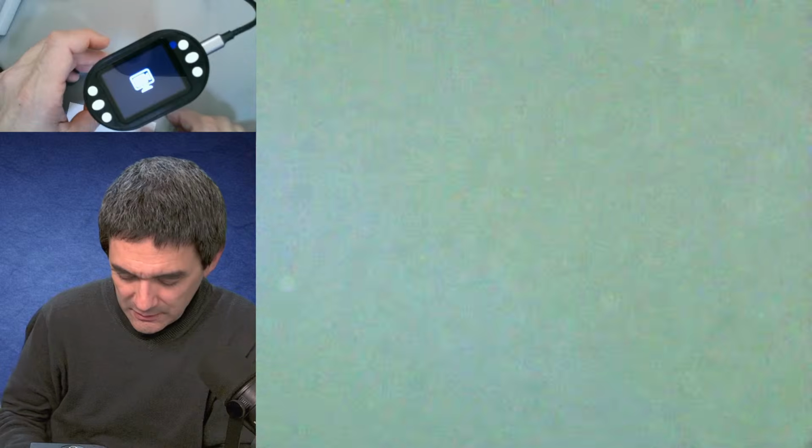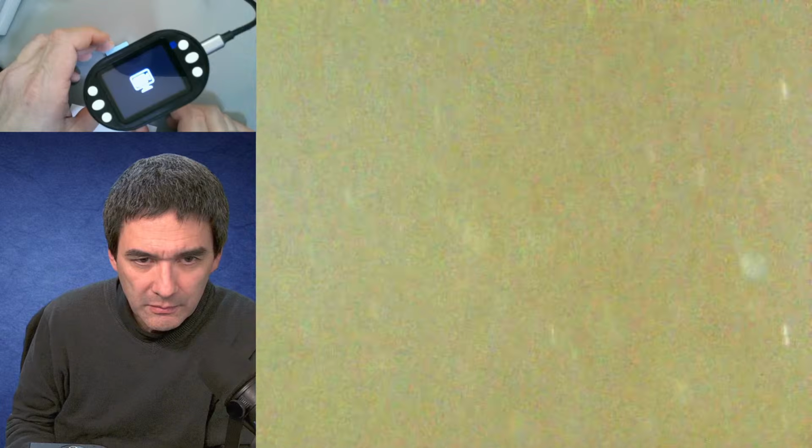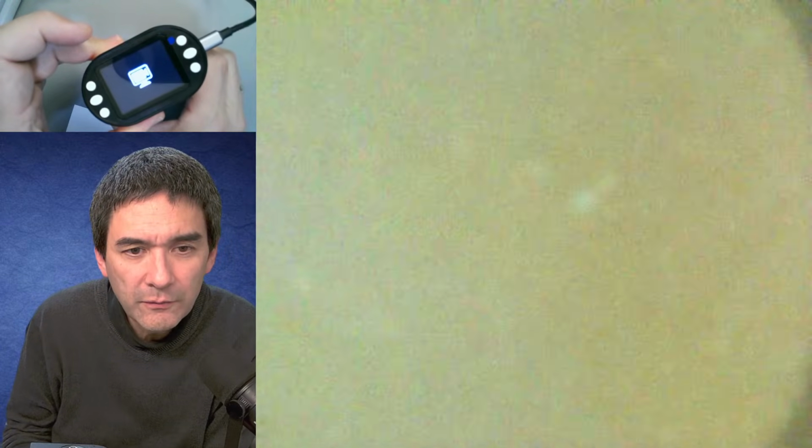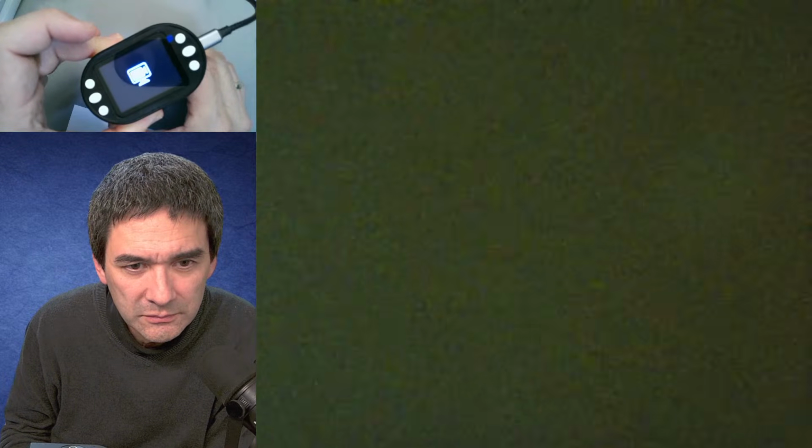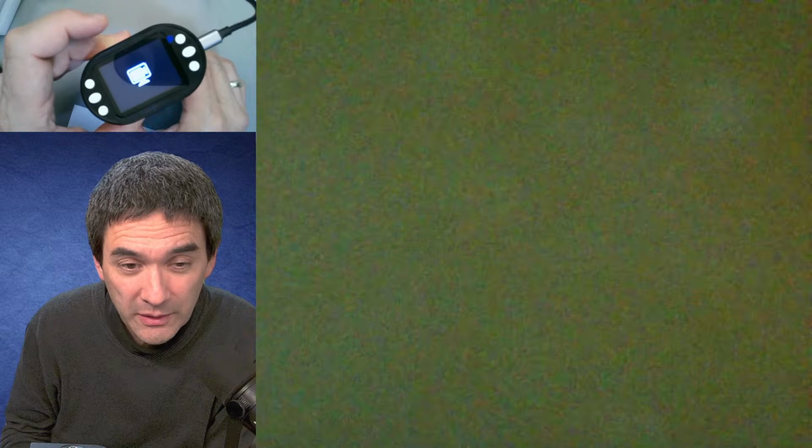I really don't know. Yeah. So. And here we are. I think, yeah, I'm right in the middle here, and let's see if we're able to see something. I'm not able to see something. So let's zoom in more. Let's zoom in more. I don't know if you're able to see something. I'm not able to see anything. Maybe here's something. Maybe.